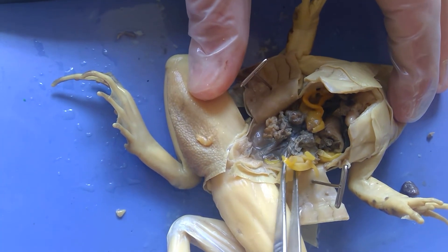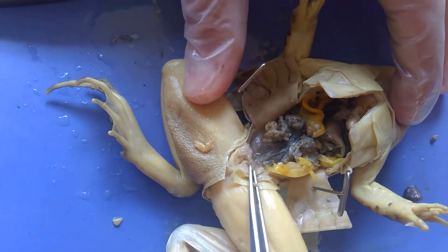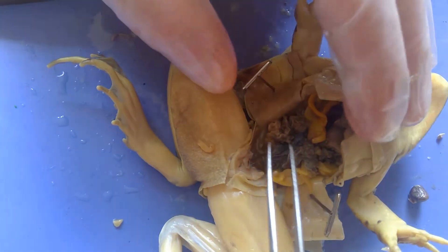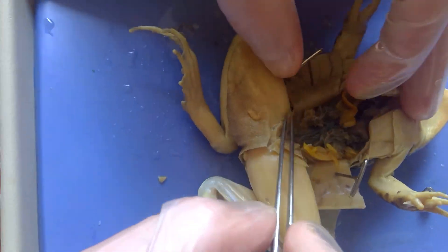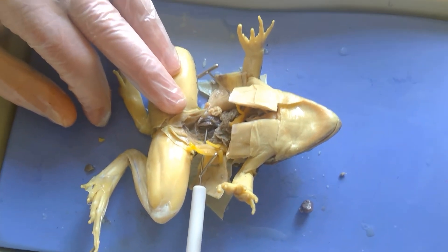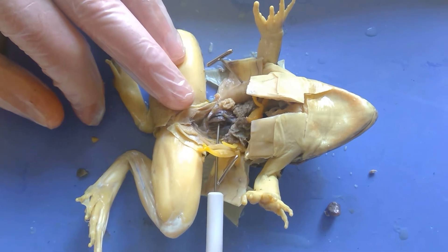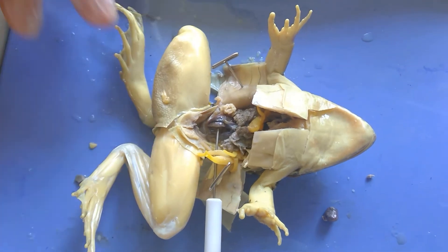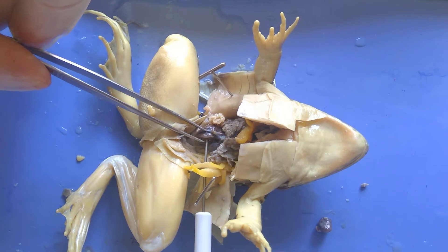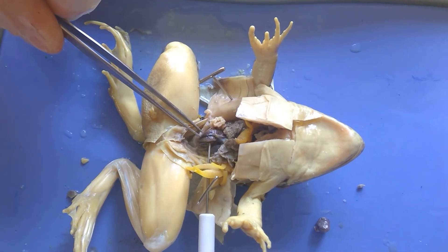I removed what is called mesentery from this, and what I'm holding up right here is the kidney.